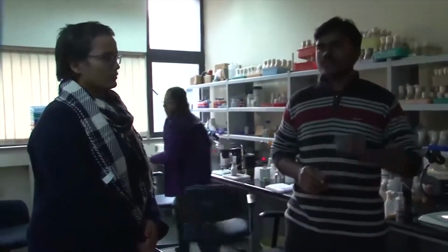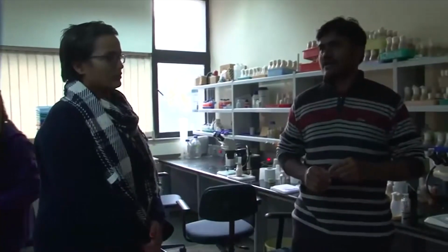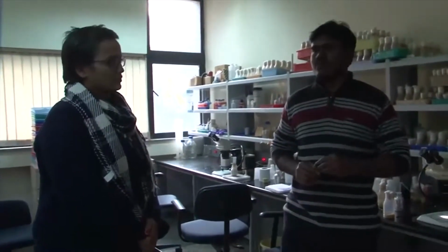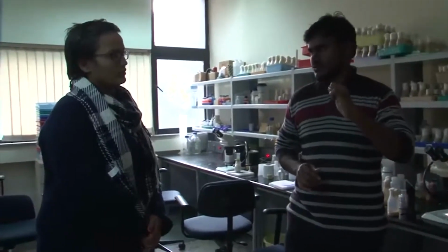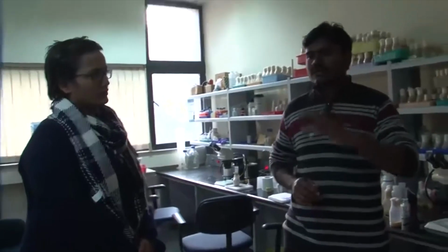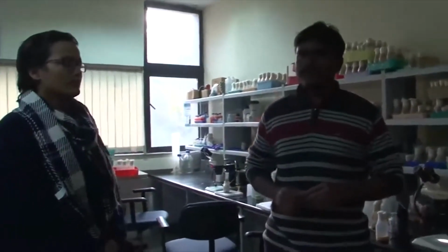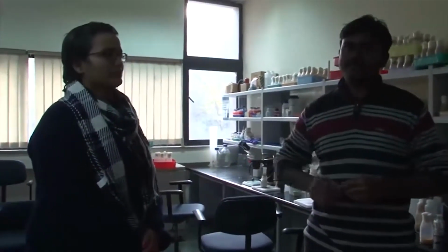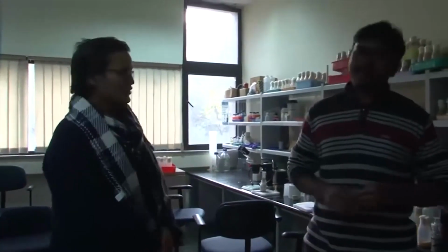In the embryo stage of Drosophila, we have a group of cells called pole cells. These are germline cells. They will do a microinjection of these plasmids into them. Now this plasmid will integrate into the Drosophila genome, so the next generation of flies will carry this transgene. Then we need to sort them out and develop the stock. That's the main thing. Thank you.